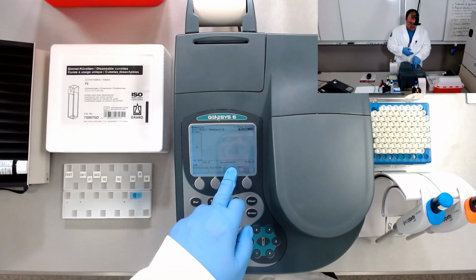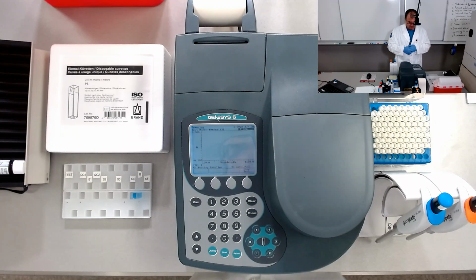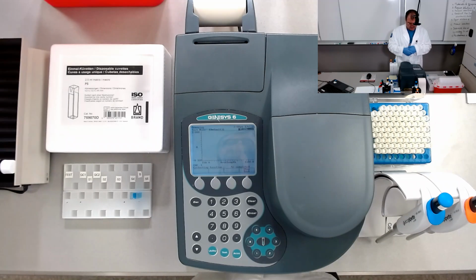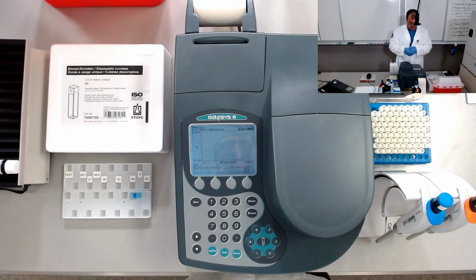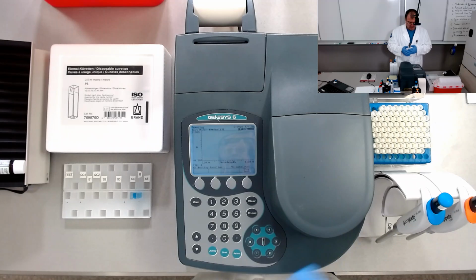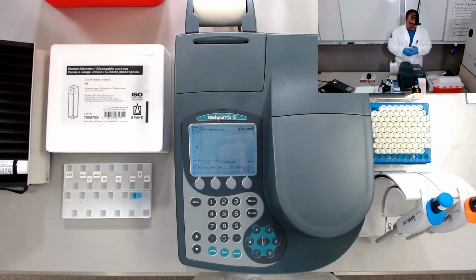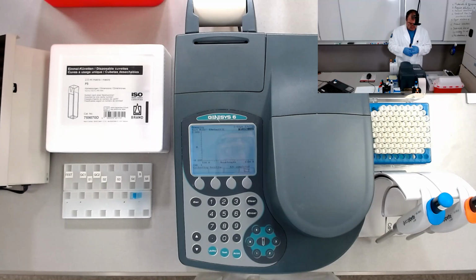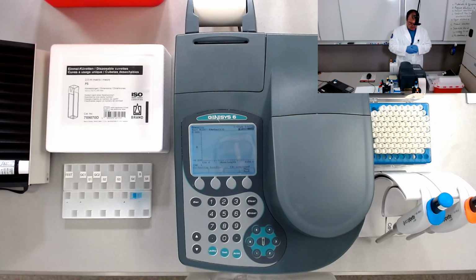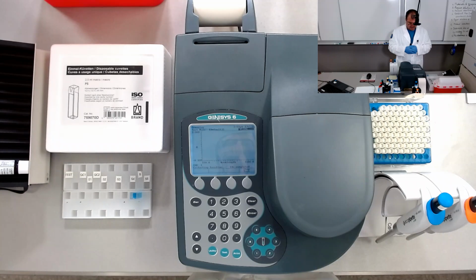It shows us the percentage of completed work, 2, 4 percent, and it goes this way until it collects the whole baseline between 190 and 1100 nanometers with a 5 nanometer step. So absorbance is at every 5 nanometers.